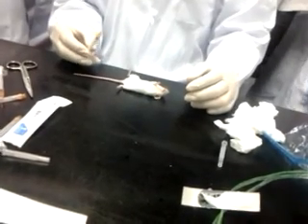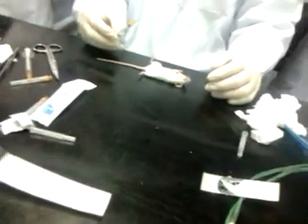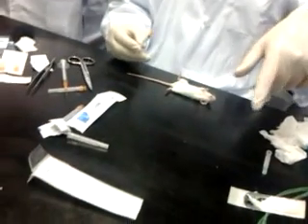But the other one you took a lot, right? Yes, because that animal is dead. I want to show cardiac puncture, and this animal is still alive. If we allow it to die, you take the maximum. Now we want to take minimal, under sterile conditions.